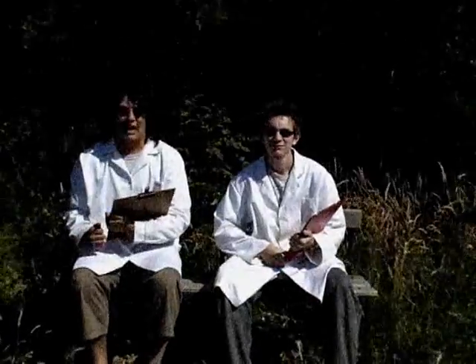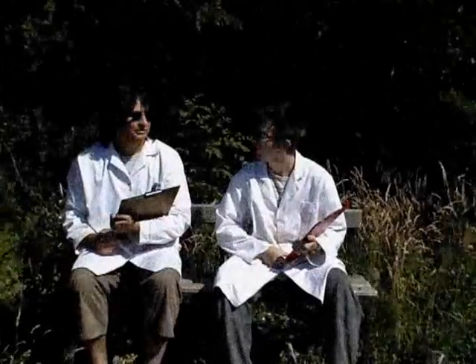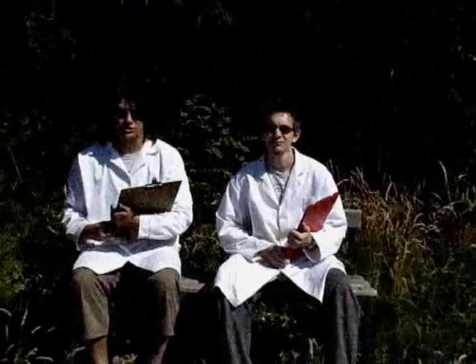When running in a lab, you shouldn't run. No, that's wrong. When you are working in a lab, you shouldn't run.